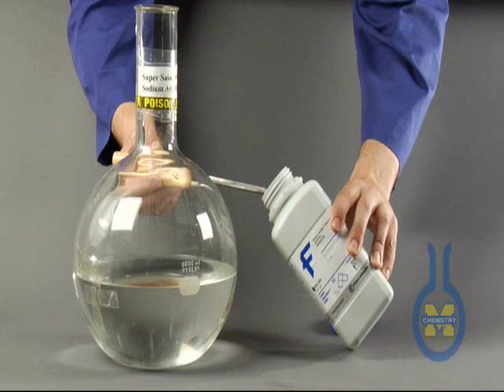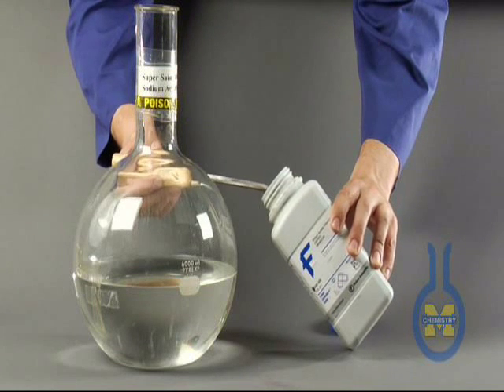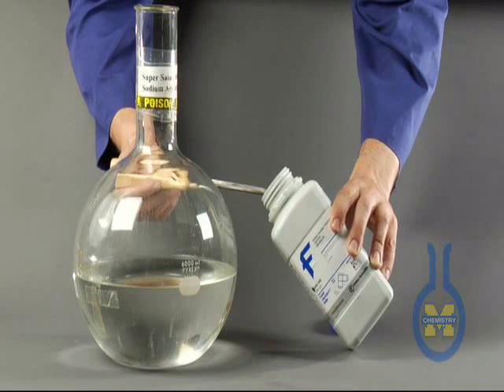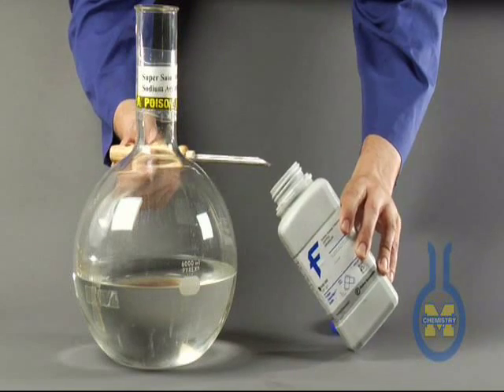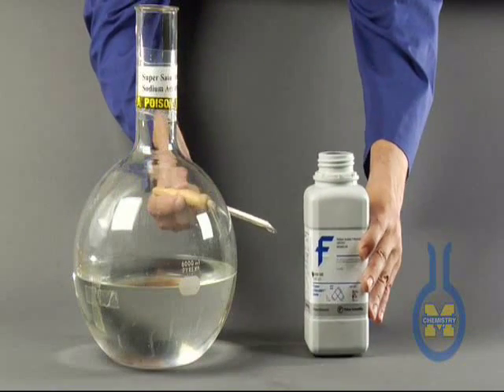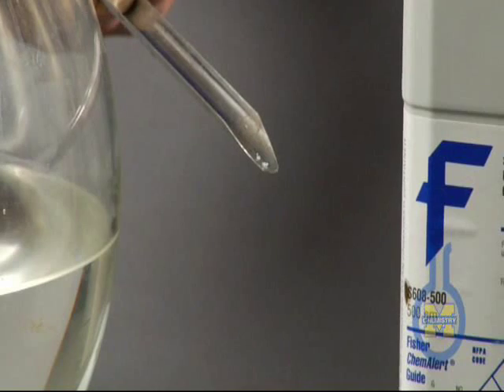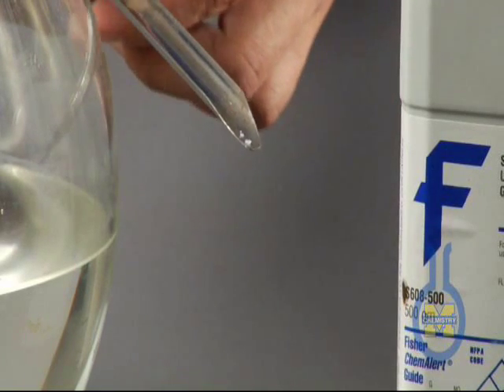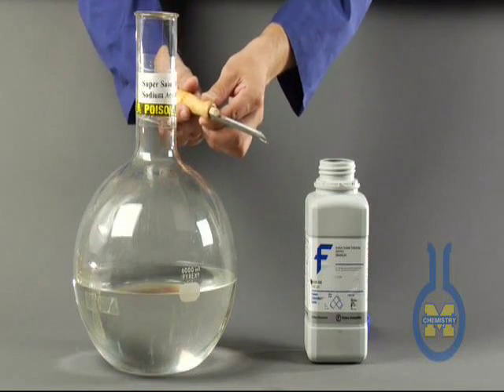And so it is at its solubility limits and we're going to add a little bit of solid salt and what you're seeing in this video is what's going to be occurring right here. The salt will precipitate out of solution.